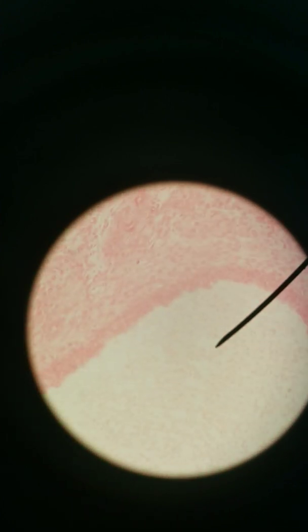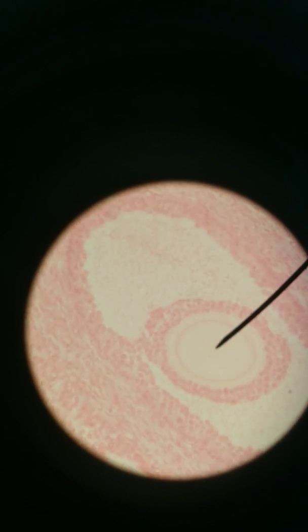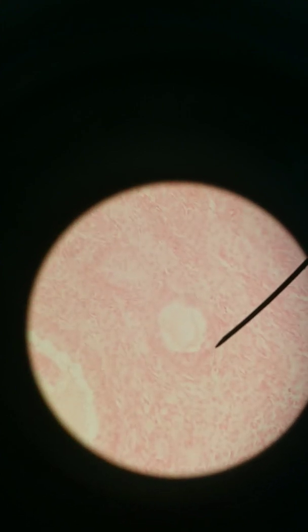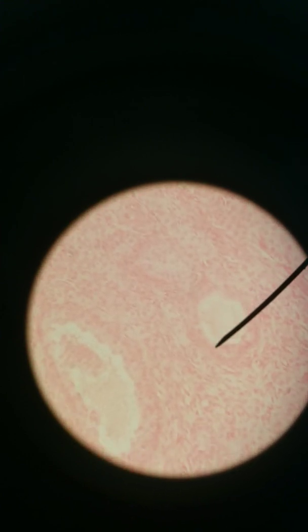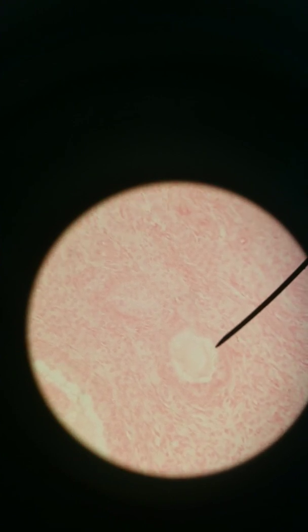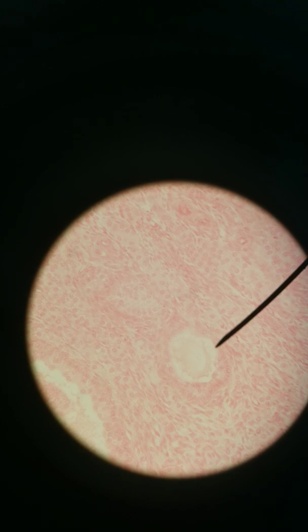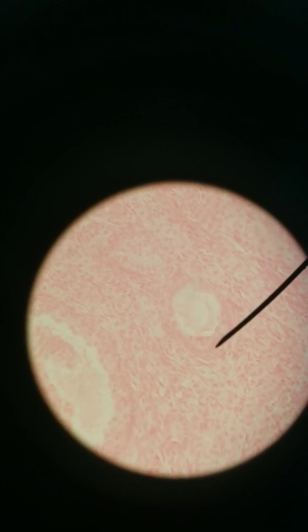Looking for a secondary follicle now. This one is a little bit bigger. We can see the oocyte from here to here in the center. We're starting to get some white space in the middle — that white space is fluid surrounding the oocyte, and that fluid space is called an antrum. Watch the size of the antrum as we go from secondary to tertiary. This is a primary-secondary follicle. You can see more granulosa cells on the outside, and I can better see theca cells surrounding that — they're flatter than the granulosa cells.